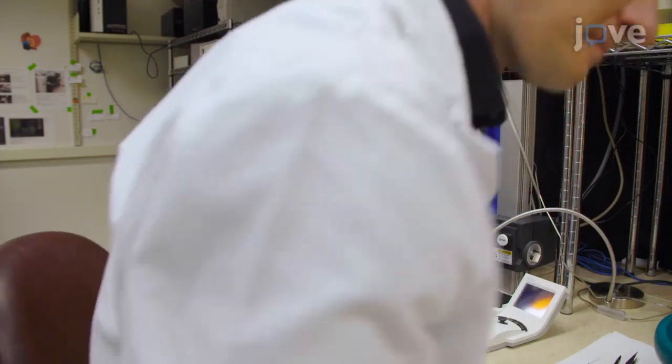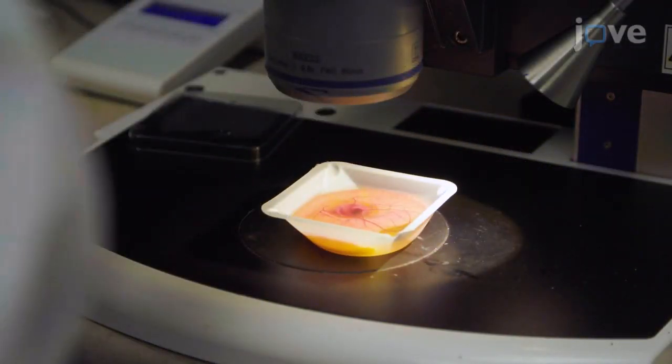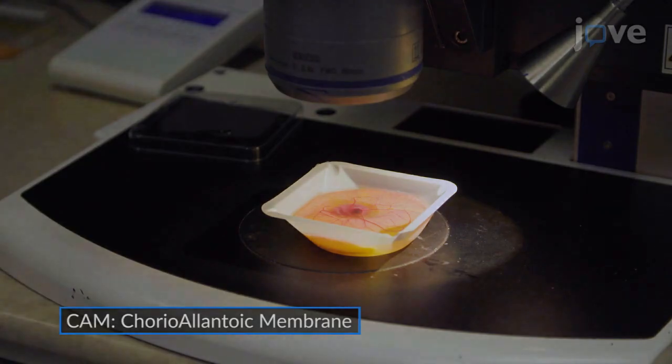Remove the cover lid and transfer the embryo under the stereoscope. Identify the appropriate vein to be injected on the cam surface.